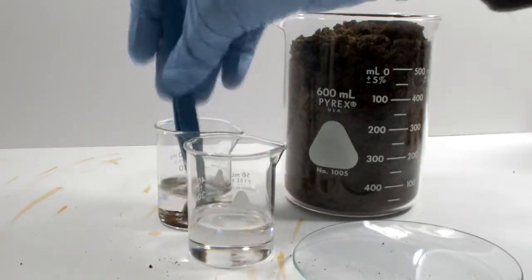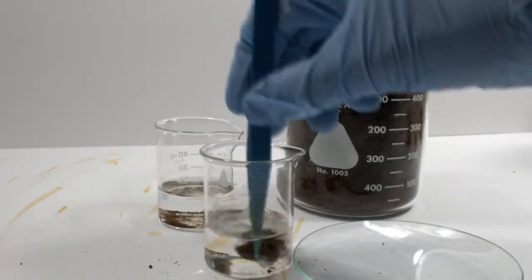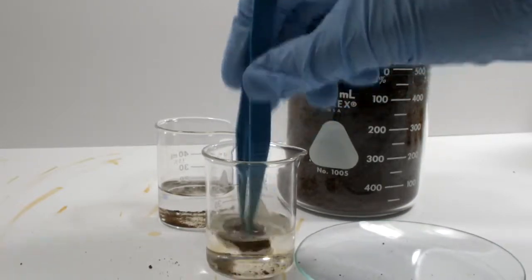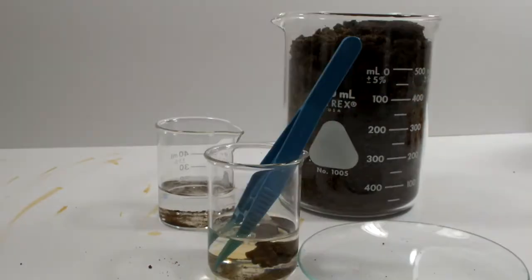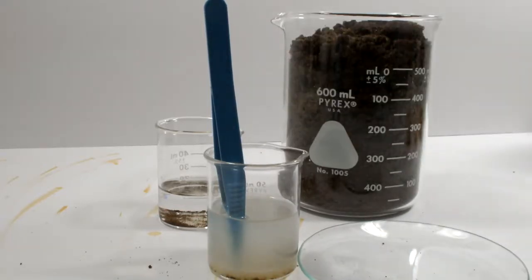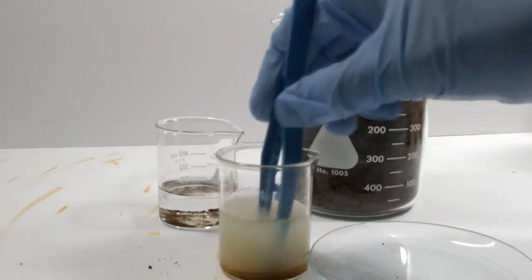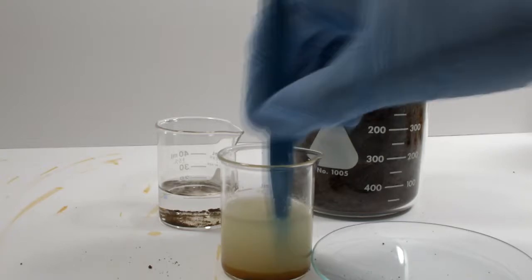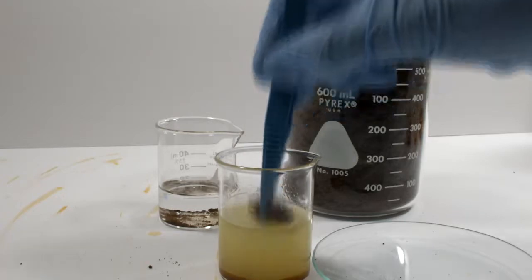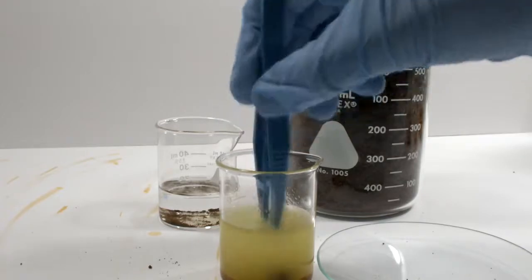Iron 2 chloride is slightly soluble in benzene, so maybe an aromatic hydrocarbon will be more effective. I don't have any benzene, so this is toluene, and I seem to be running into the same problem as with the aliphatic hydrocarbons. Just for fun, I wondered what would happen if I added 70% isopropyl alcohol to the toluene and go for some kind of mixed solvent effect. It seems like the water separates from the isopropyl alcohol, which in turn combines with the toluene. The top layer does take on a greenish tint, while the water layer is an orange color. This isn't a viable method, but it is an interesting result.